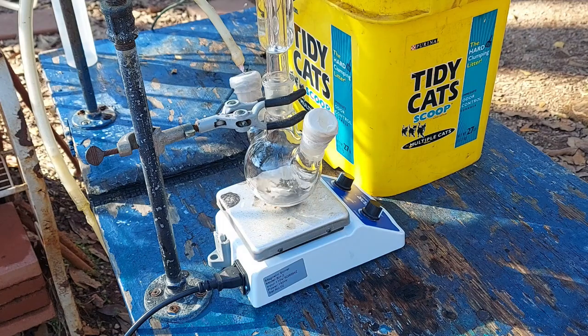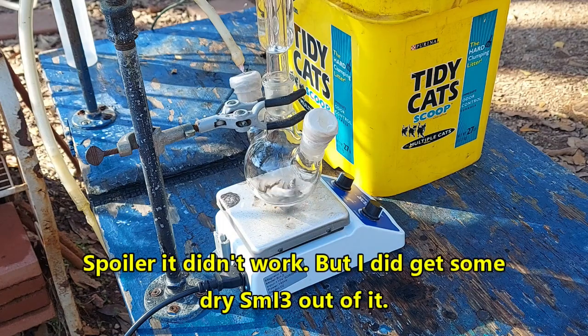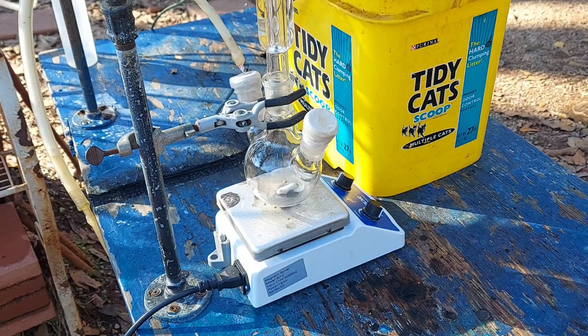Like I said, this is either going to work or it won't. This is my last attempt with this — I've been after this compound for years. If doing everything that I've done isn't enough, then it's just not practical to try to make this stuff in my backyard lab. This is a compound that's known for being tricky even when you're making it in a regular chemistry lab.